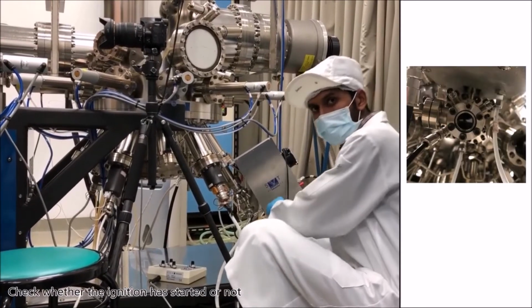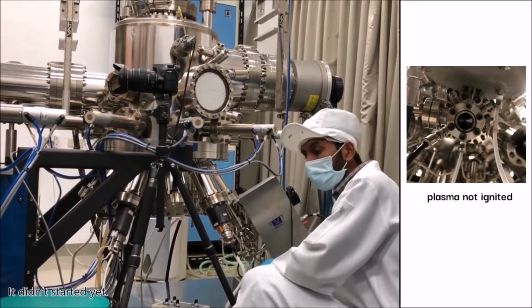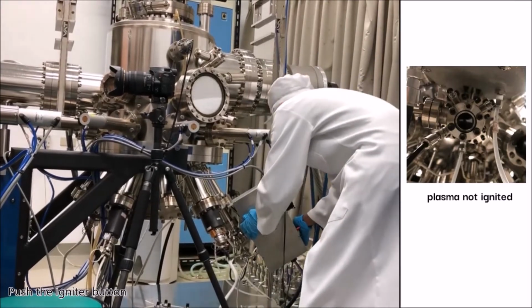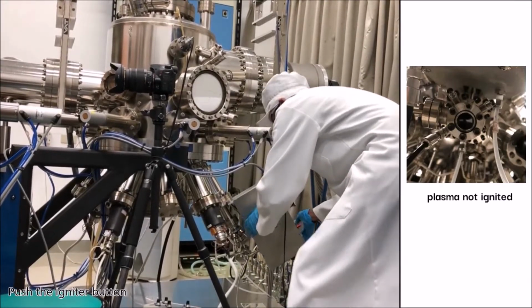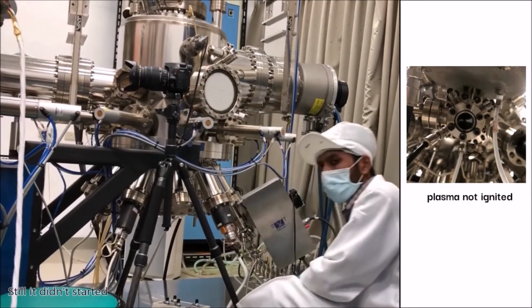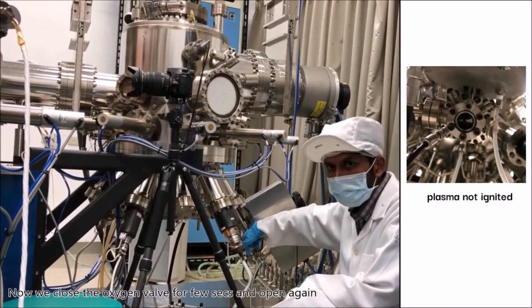Check whether the ignition has started or not. It did not start yet. Push the igniter button. Still, it did not start. Now we close the oxygen valve for a few seconds and open again.